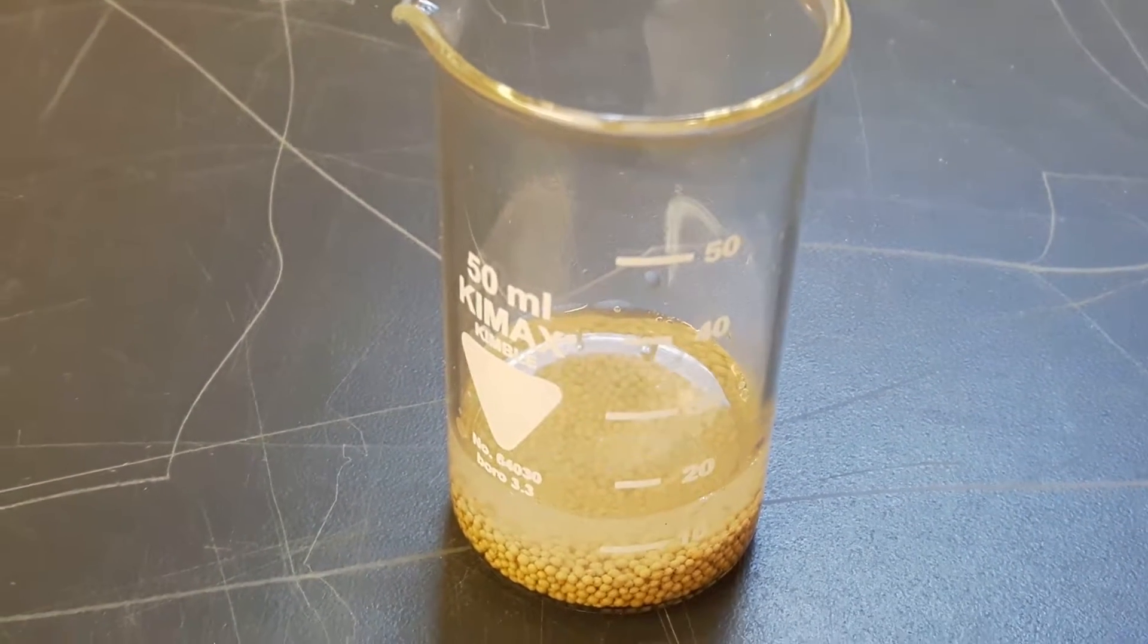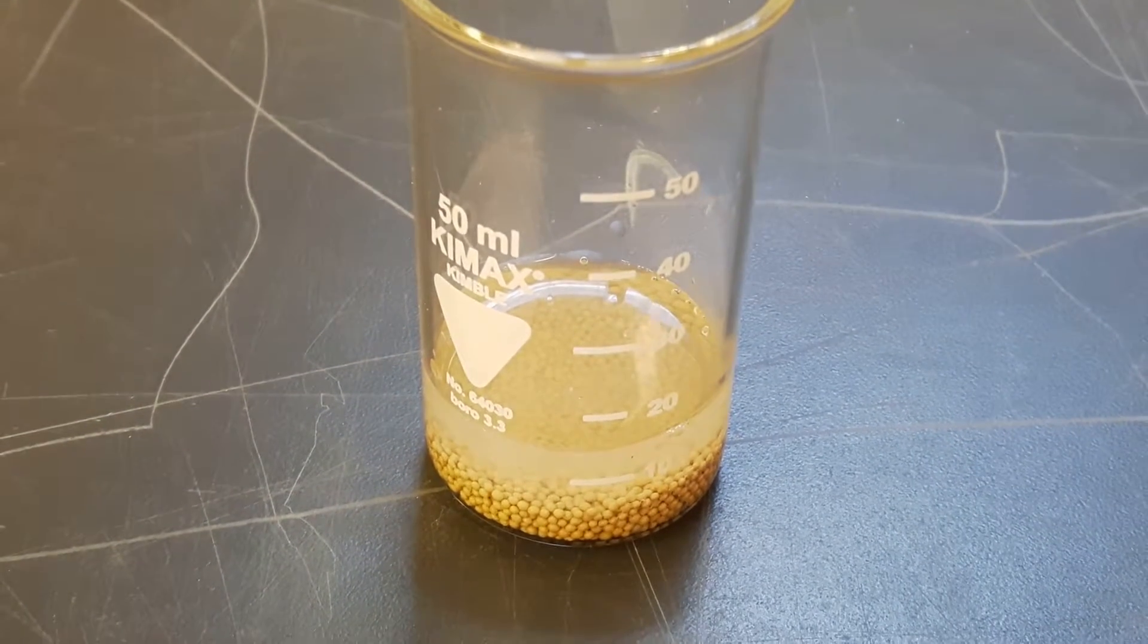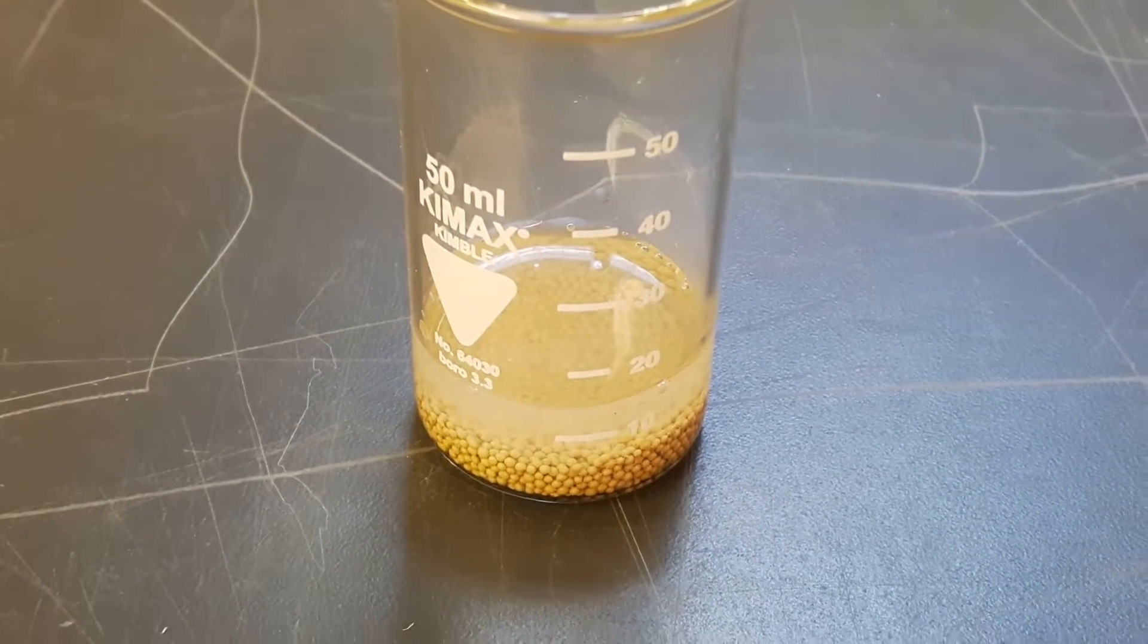So, if everything works right, the water will be absorbed and we're left behind with 100% acetic acid.